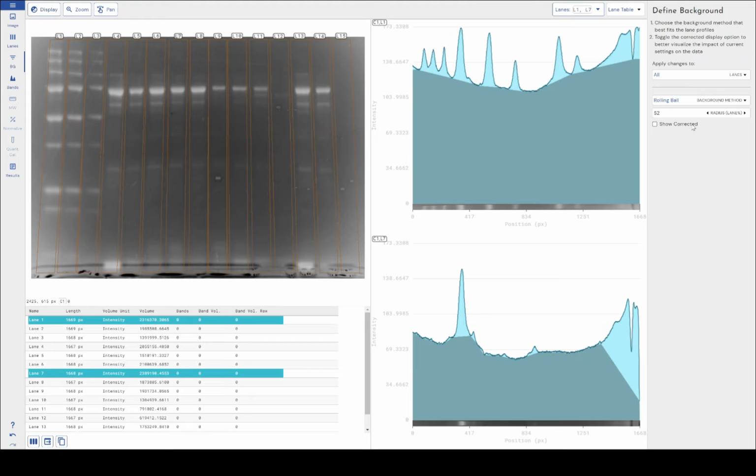With the advent of longer lanes and higher resolution images, we reached a point technologically where defining it at the pixel level, you had to make huge changes in pixel radius to notice any actual change in your background subtraction. What that meant for the user was it wasn't a great UI choice to have to change numbers by thousands to see even a very small change. So we came up with a way of doing it as a percentage of the lane length, which is much more adaptive and capable of handling very short lanes, but also very long lanes, very low resolution lanes, and very high resolution lanes.